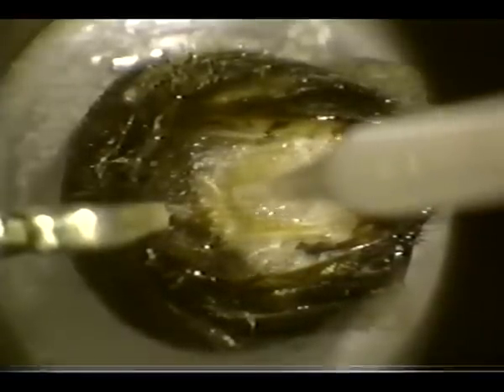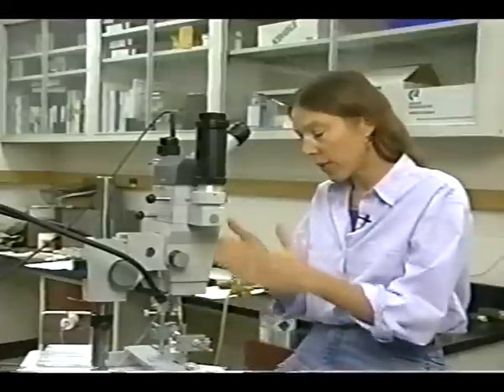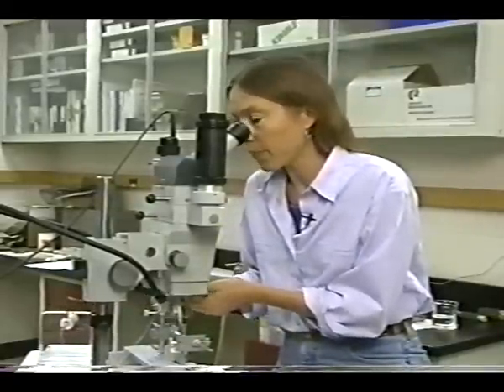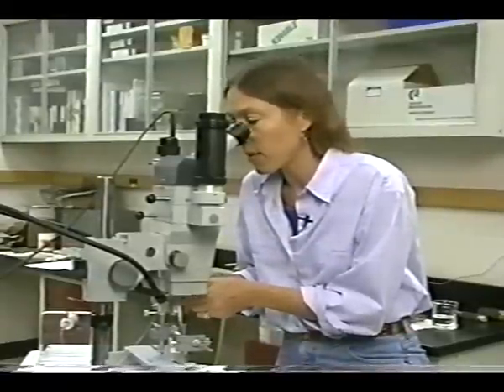If you come in too high, you're going to sit on top of that valve fold again, and what's going to happen is the semen is going to back up — obviously that's not going to be correct. If this happens, you want to remove the syringe tip and look at your alignment. Is the queen straight, or are the hooks pulled too far to one side or the other? Have you come down too high on that V? Just reposition your hooks and your alignment and try the insemination again.